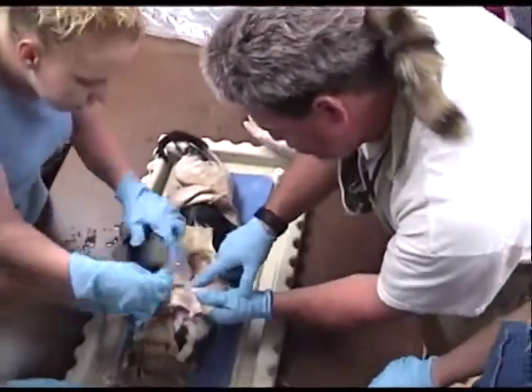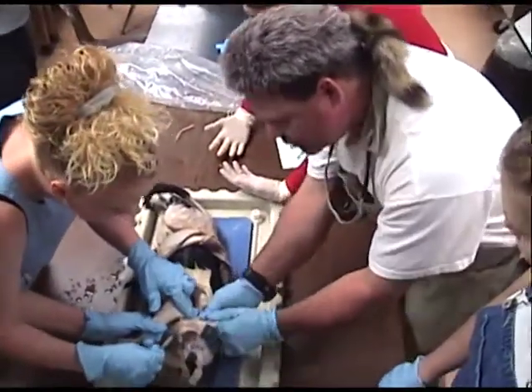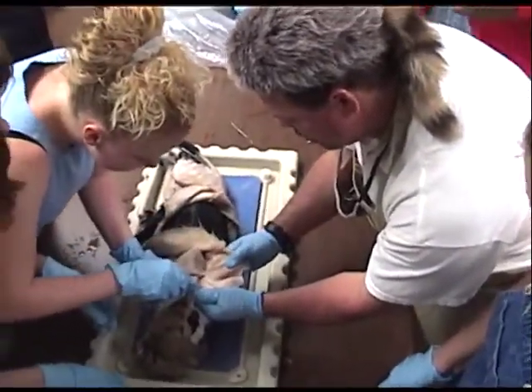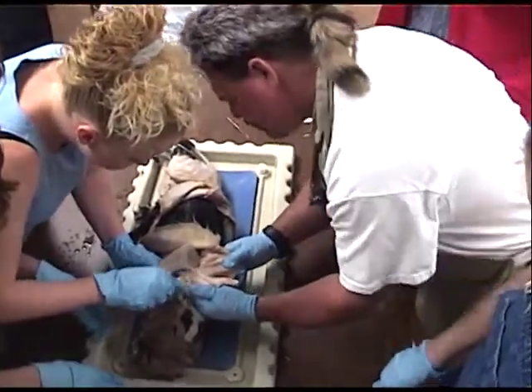See how the skin is right there? Yeah, but that — what is that? That's something tough. You're alright, go ahead. Make your cut. Make your cut. Scissors.